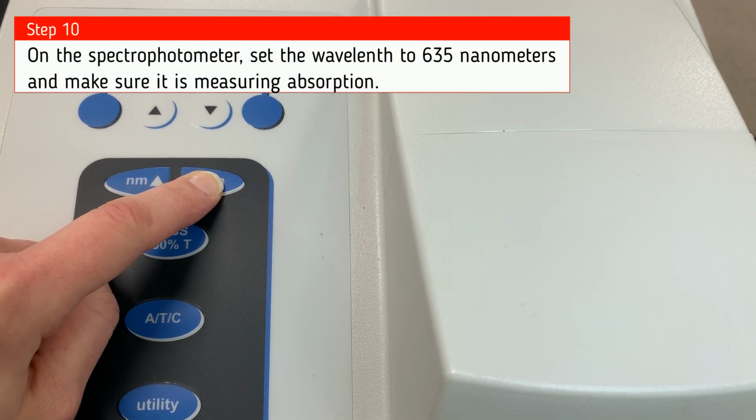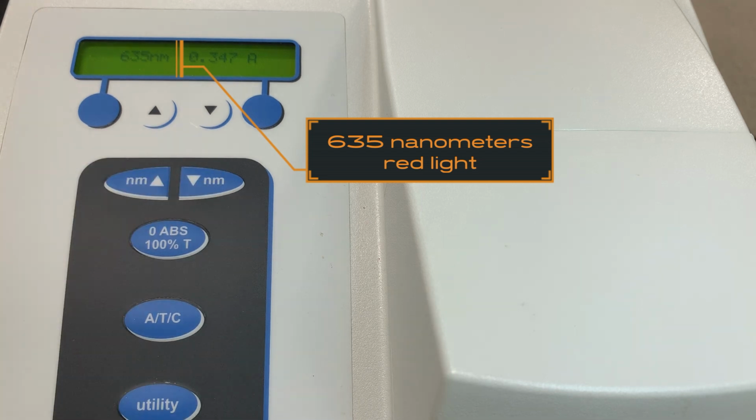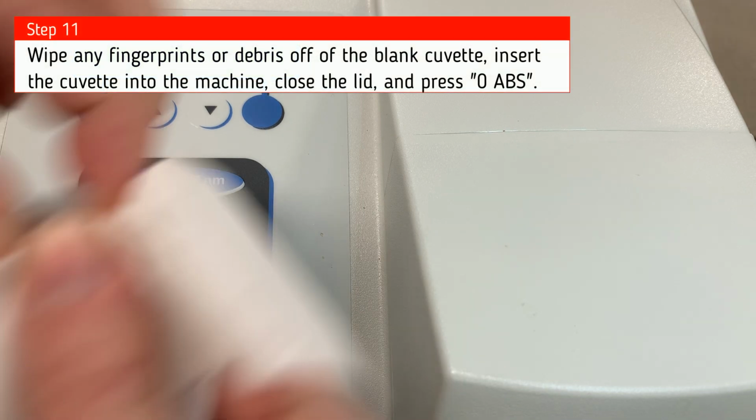On the spectrophotometer, set the wavelength to 635 nanometers and make sure that it is measuring absorption. 635 nanometers represents red light. Alright, the first thing we're going to do is set our blank.